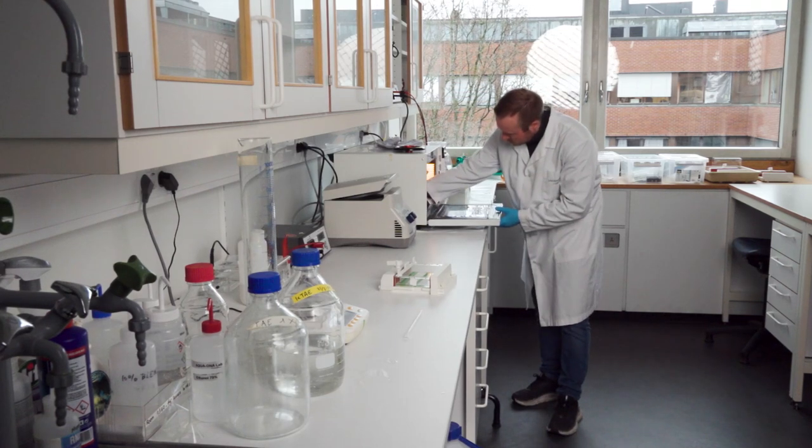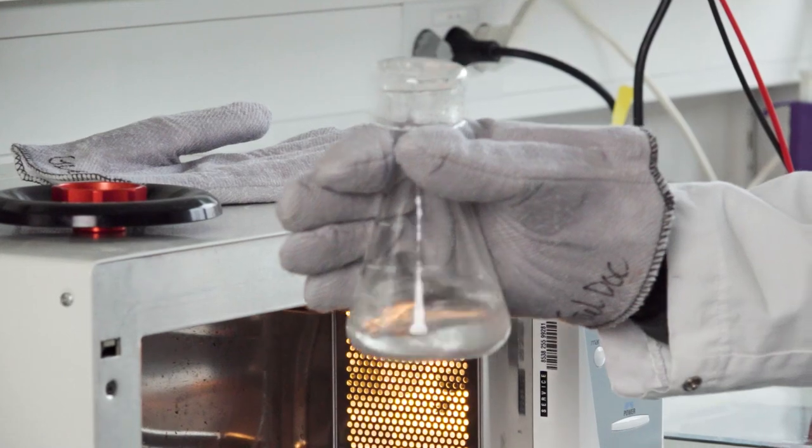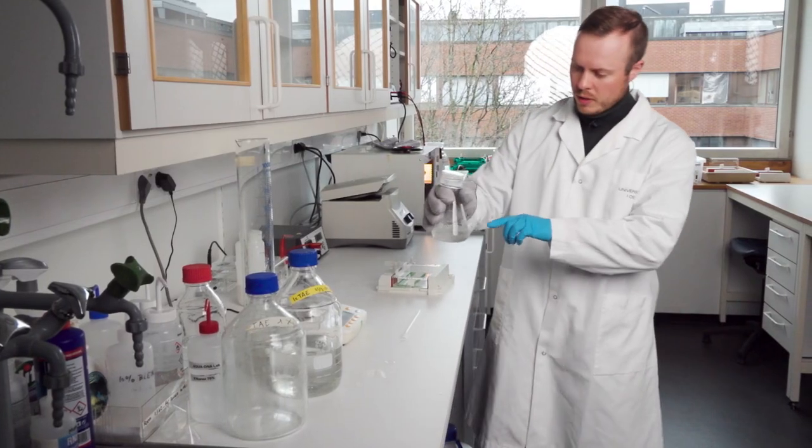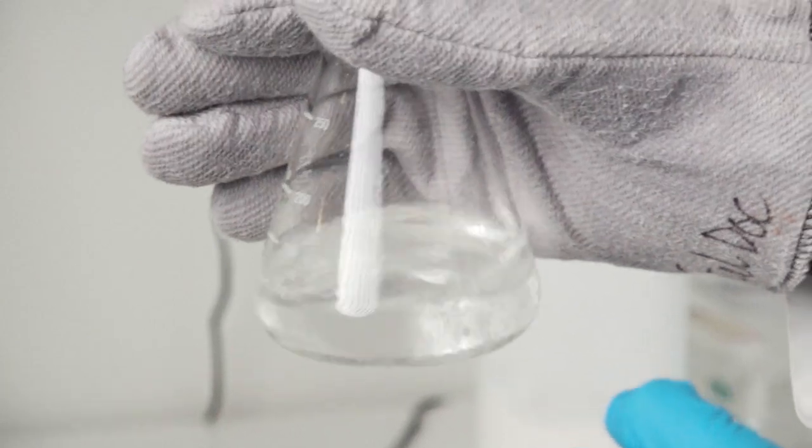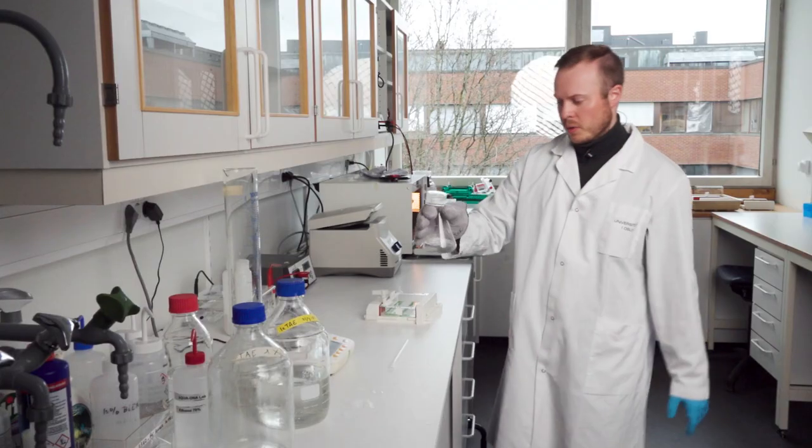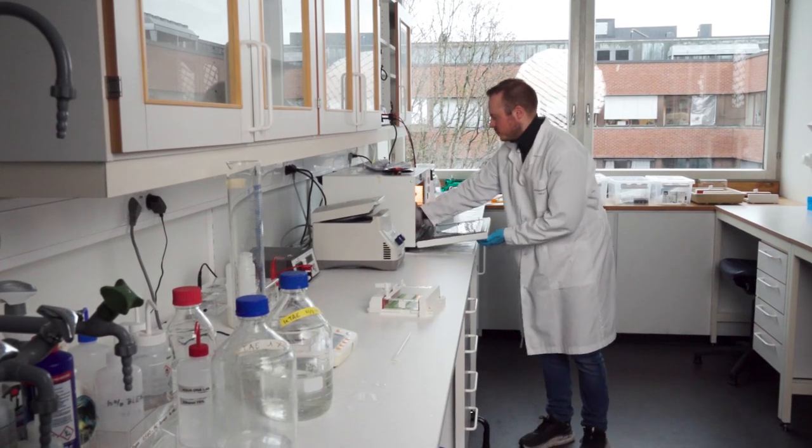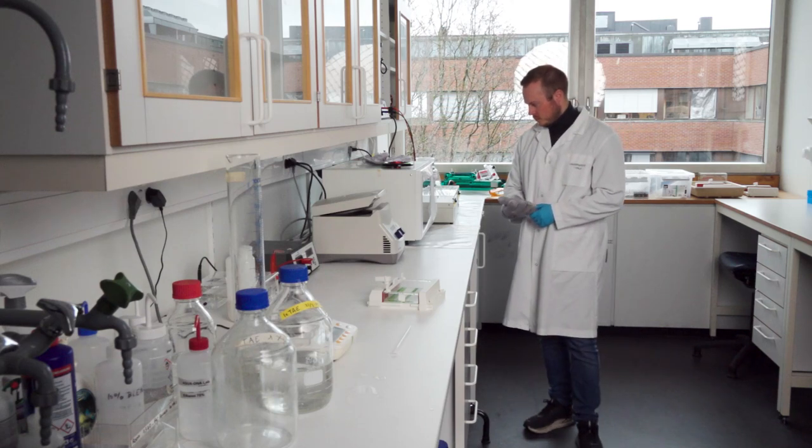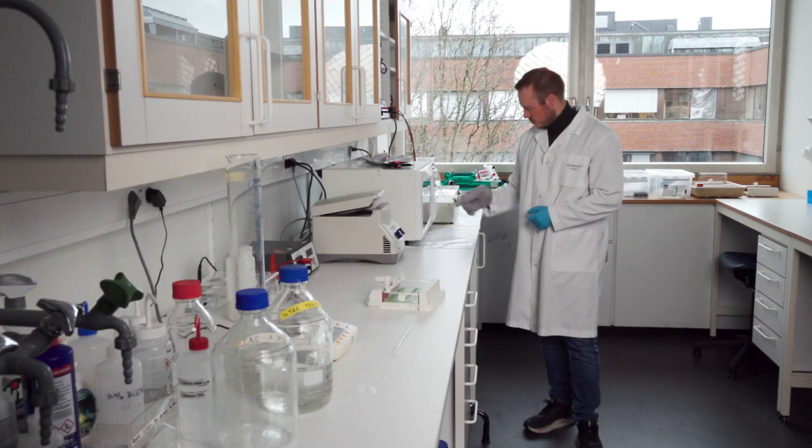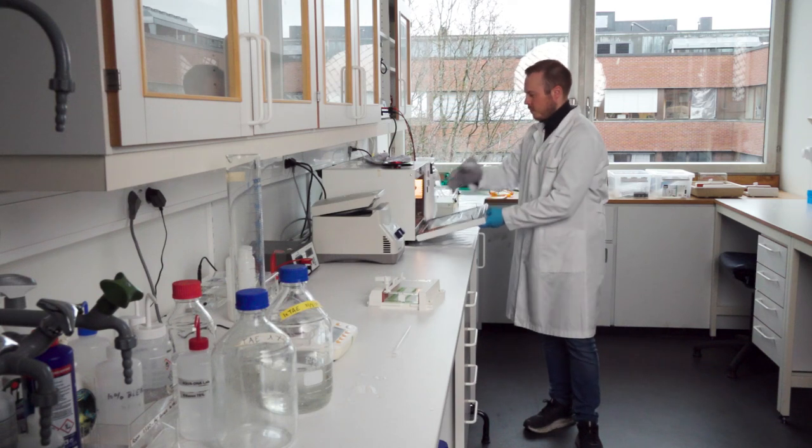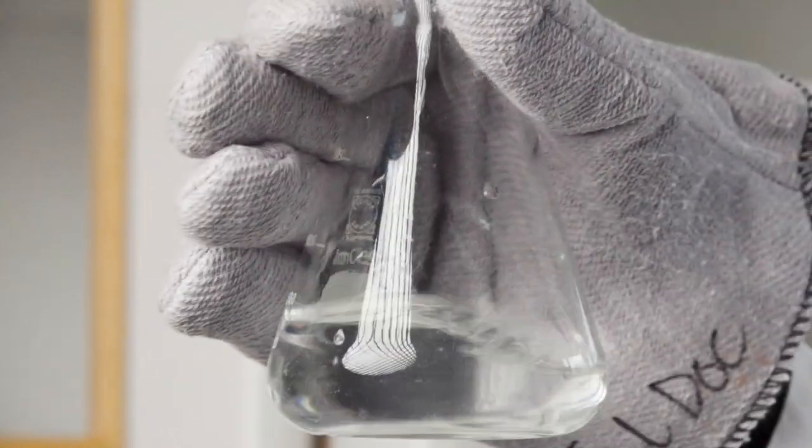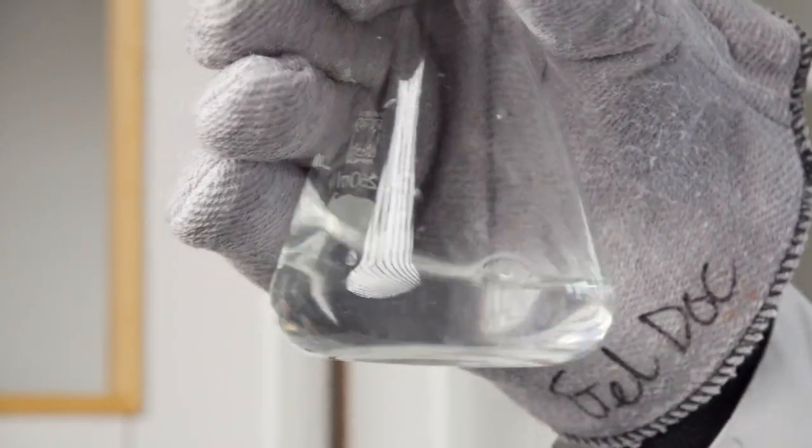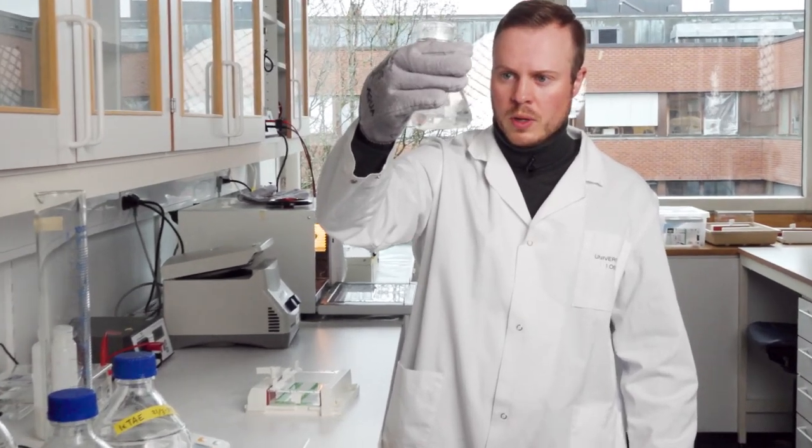I take it out and gently shake it. When I look down in the flask, I see particles of the agarose that aren't completely dissolved, which means I need to run it once more. It's boiled again and the solution is getting way clearer, but I still see small particles, so it needs one more time to be completely dissolved.